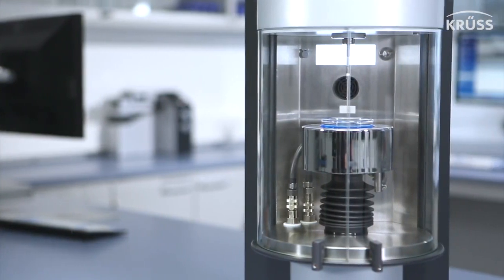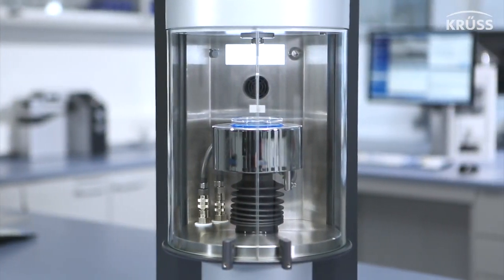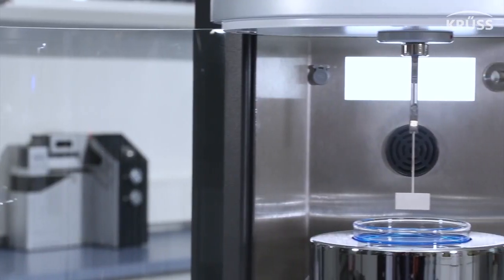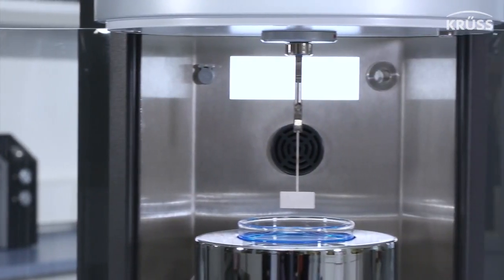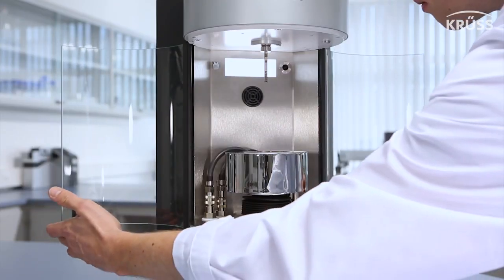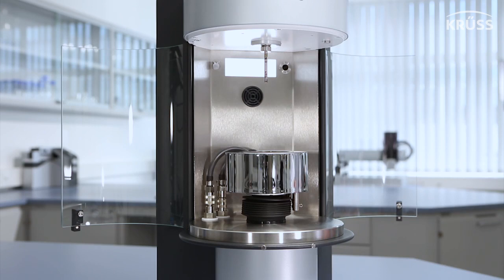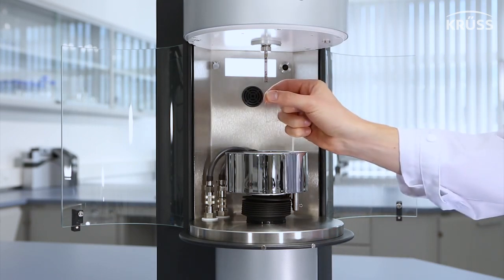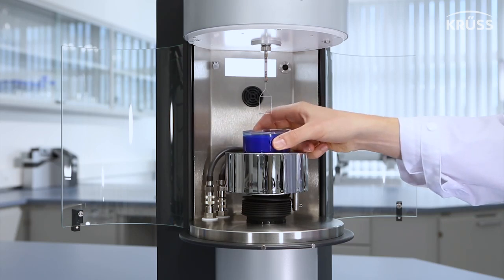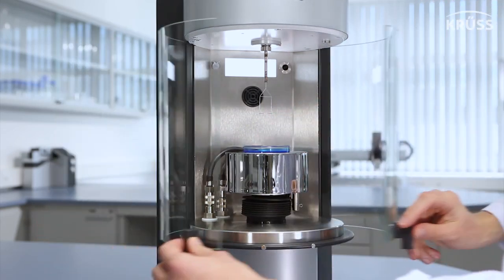All of these useful and versatile instrument components are housed in an extra-large sample chamber, which is finished with chemically resistant and easily cleanable stainless steel. The sample chamber features two durable glass doors, which open very widely to offer easy sample loading and adjustment, and which protect the measurement from wind disturbances.